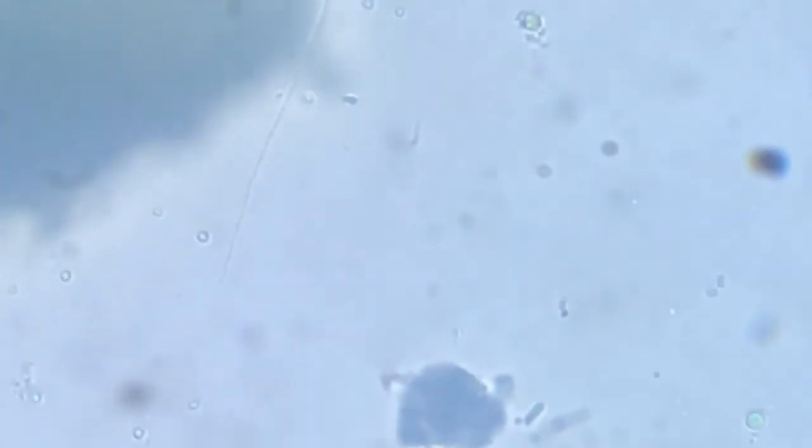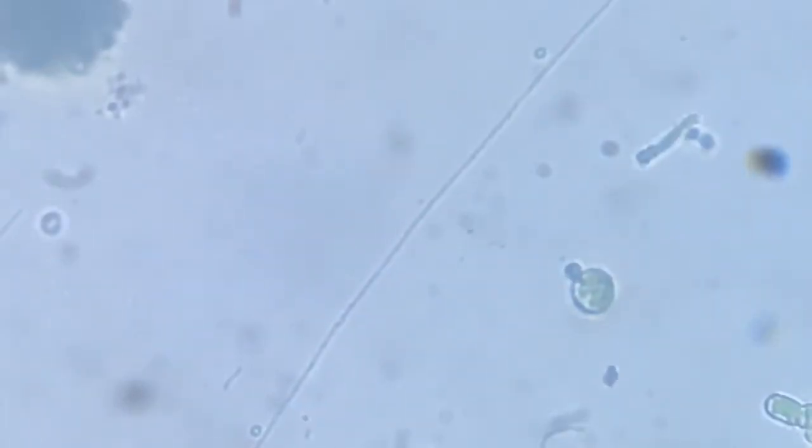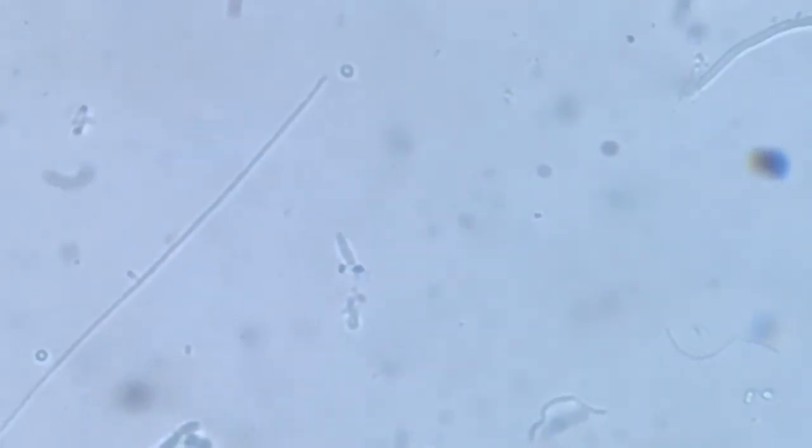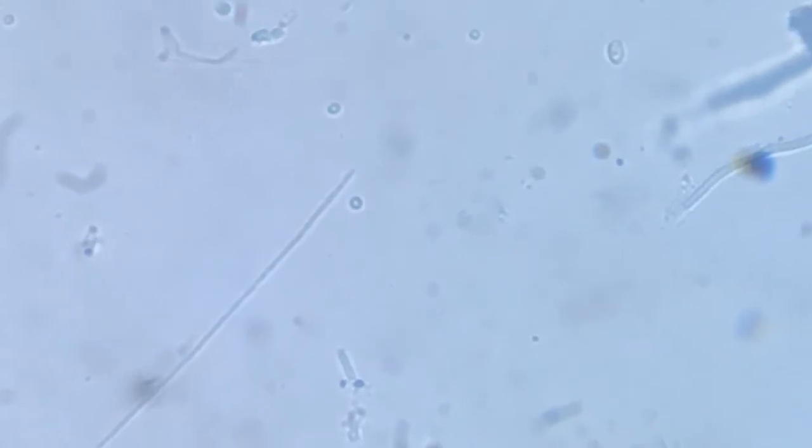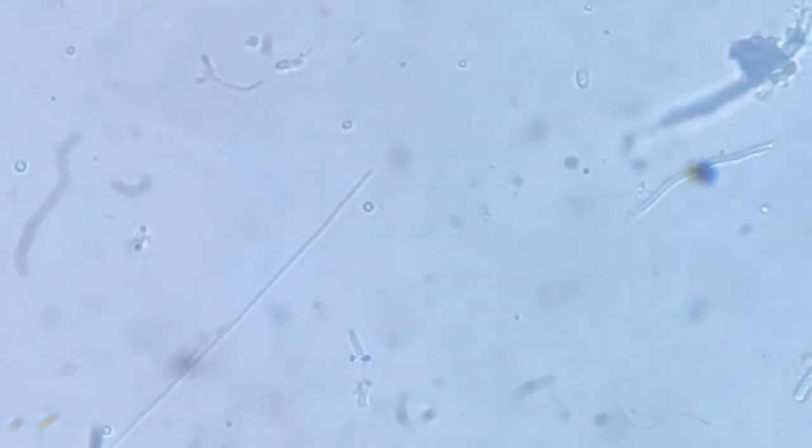And it is in a straight line, almost like a highway, and is going to an extended length. And this is one of the largest of such thread-like structures that I've seen. It could be a worm, it could be... I don't know what it could be. I'm totally confused about its identification.